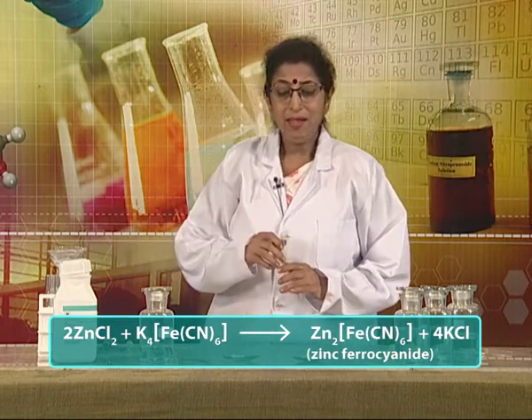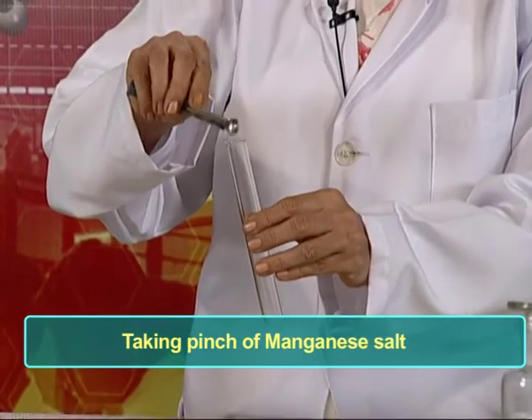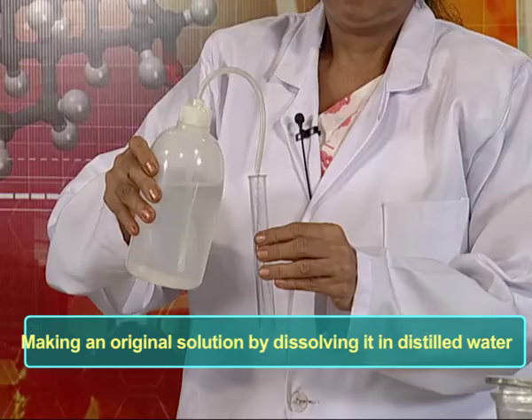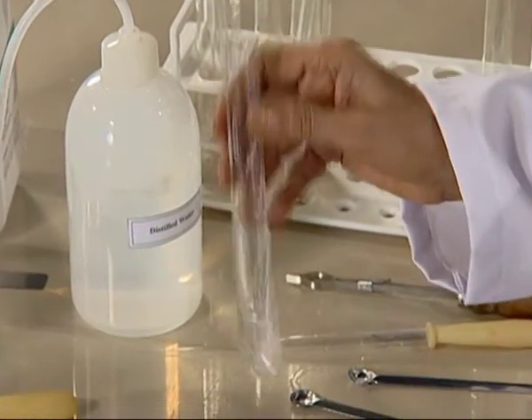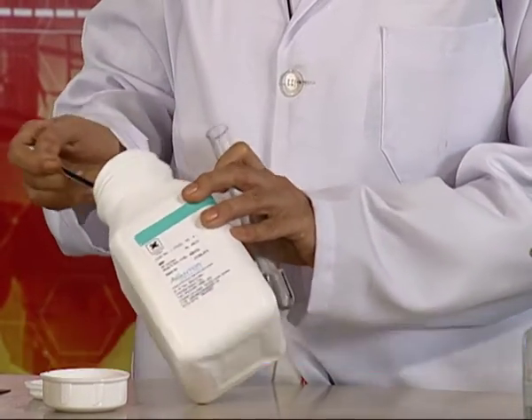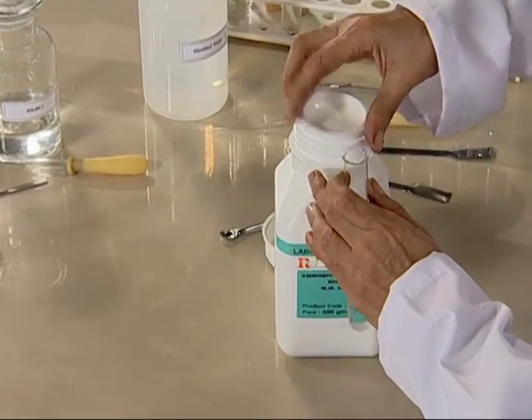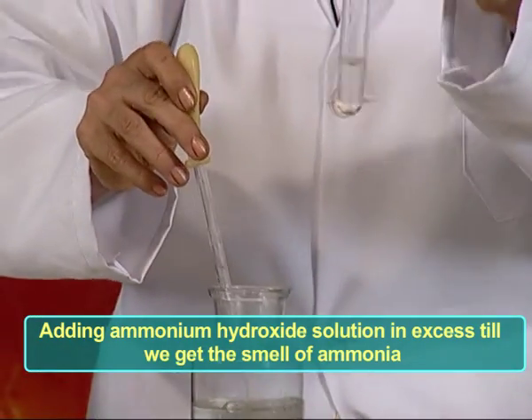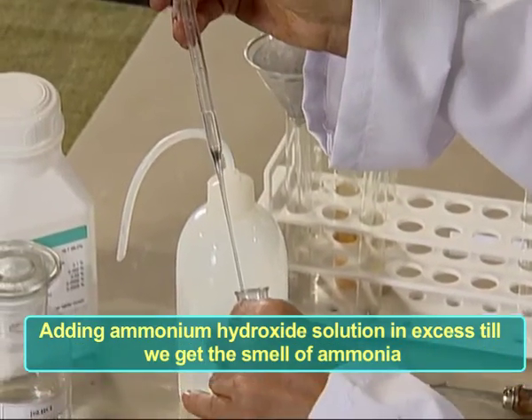Now we perform the analysis of another group 4 cation, that is the manganese cation. We take a pinch of manganese salt and make its original solution. We shake it well. In this original solution, we add a pinch of solid ammonium chloride. Then we add ammonium hydroxide solution in slight excess until we get the pungent smell of ammonia.